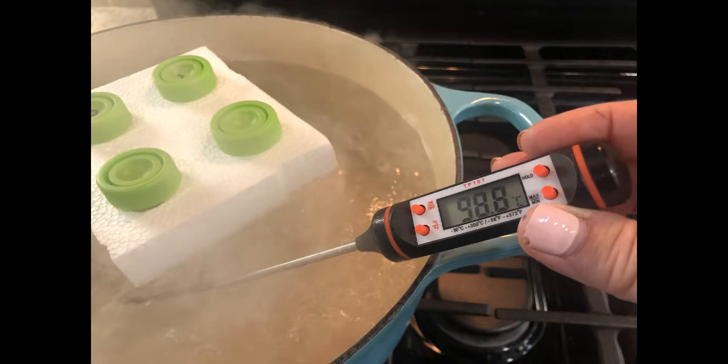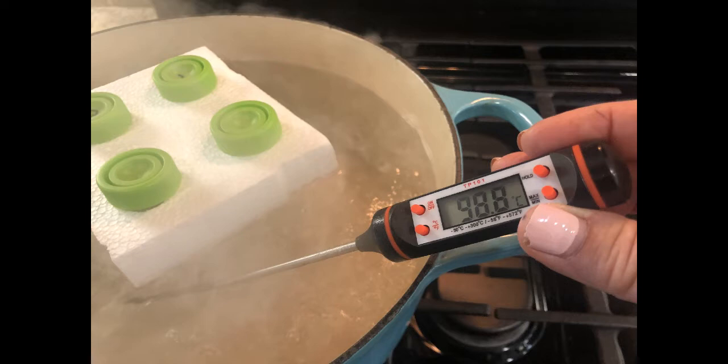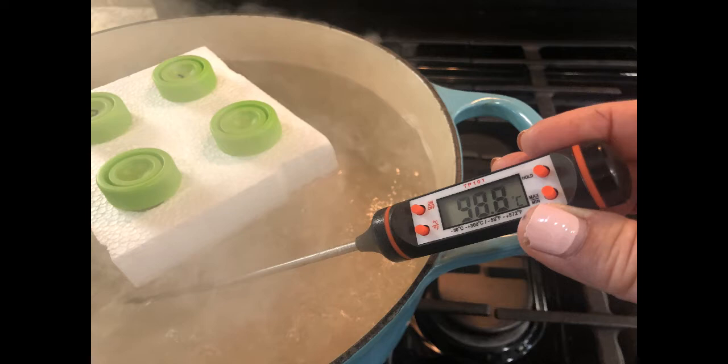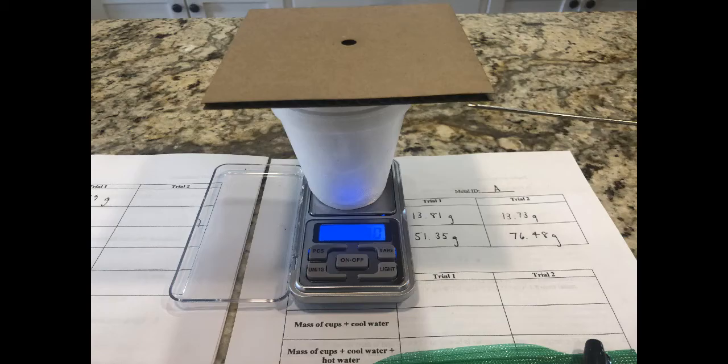Keep in mind that as you're heating water it will form gas, so the lids especially for the water-containing test tubes need to be loose so that gas can escape and you don't have a pressure buildup. You want the caps on there loosely for at least 10 minutes in boiling water.